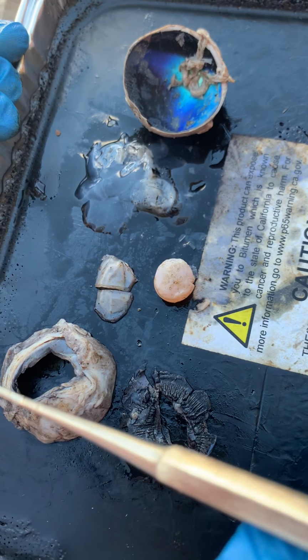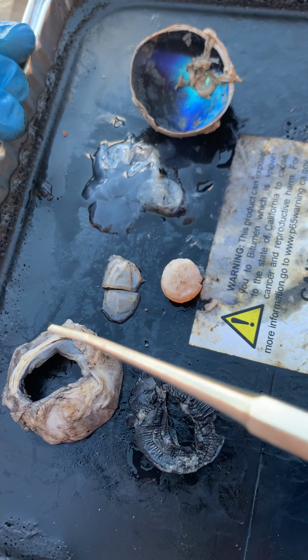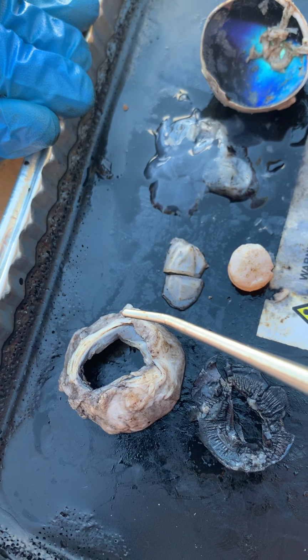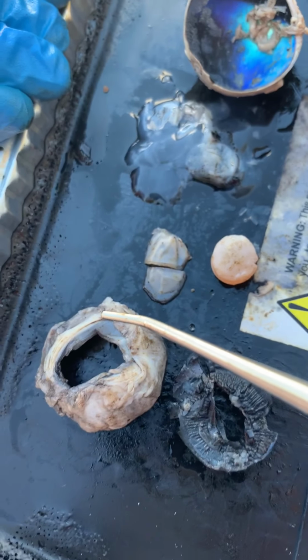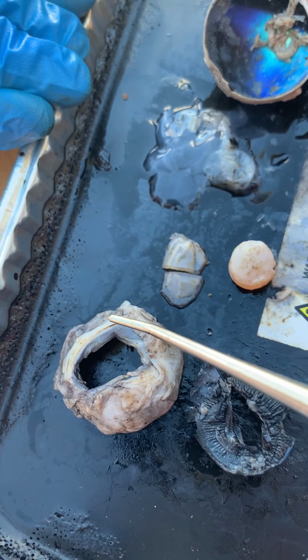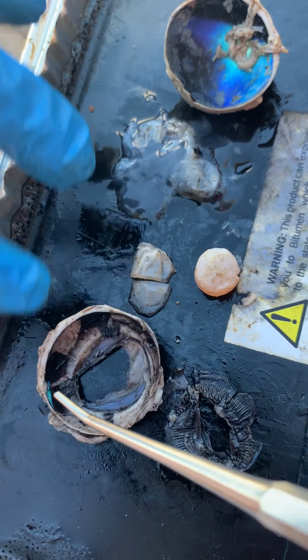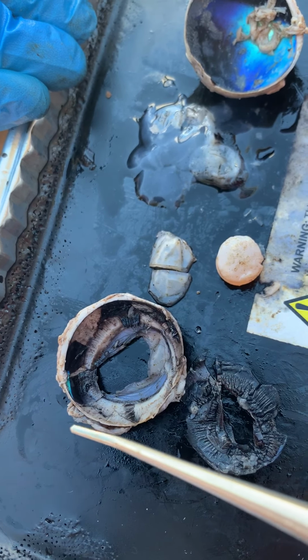The front portion of the eye is suspended in a fluid called aqueous humor, which is primarily made up of water and functions to deliver nutrients to the anterior portion of the eye, and it also helps maintain pressure in this area. It can't be seen here just because it's mainly made up of water, so it's not very visible. The lens rests in a hyaloid fossa, which is the indentation within the eye that would be seen if the vitreous humor were still intact.